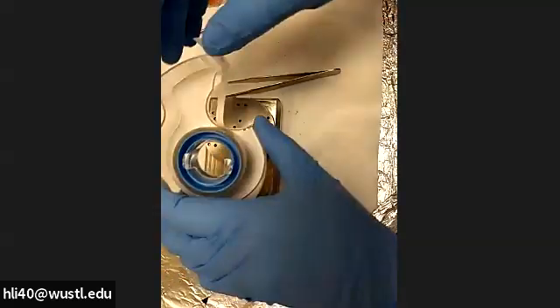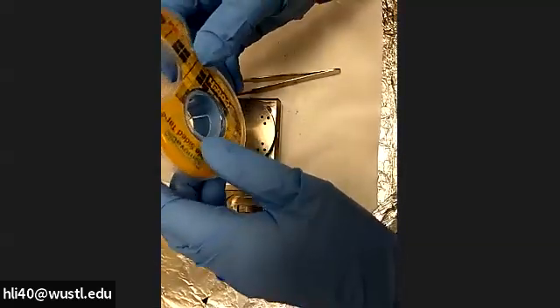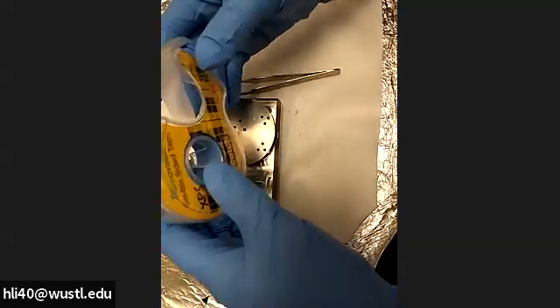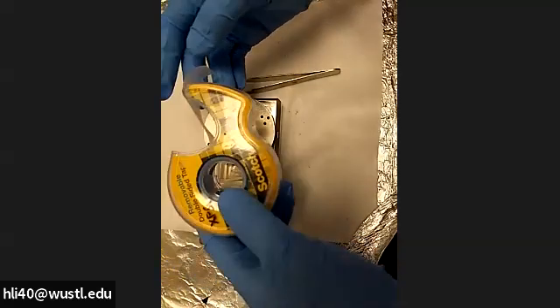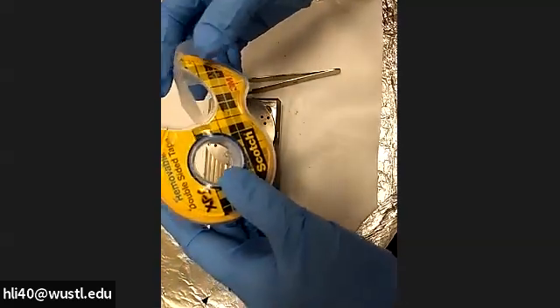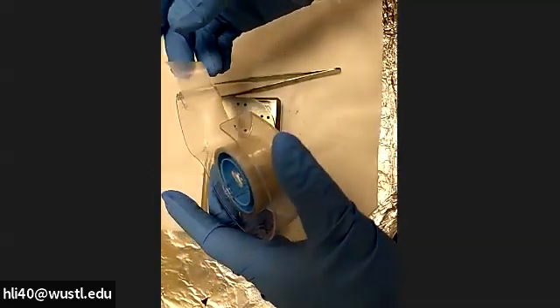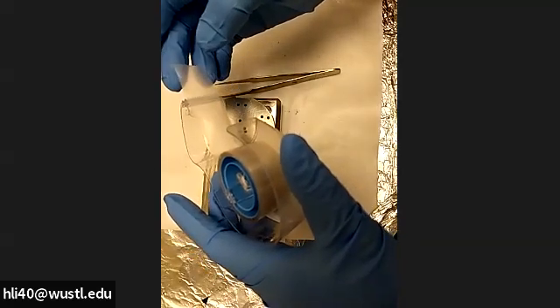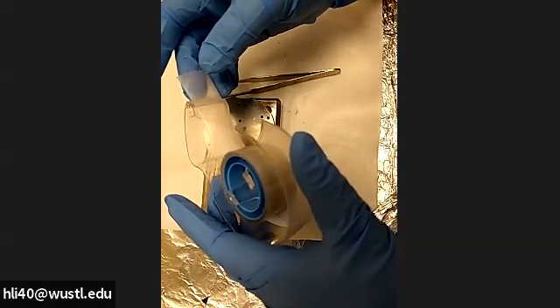To mount the sample, we use double-sided tape. Only use the tape provided — do not bring your own double-sided tape. This is the only vacuum-compatible tape in this room approved for the instrument. Carbon tape or other double-sided tapes will not be able to go to high vacuum, which is required for the XPS experiment.